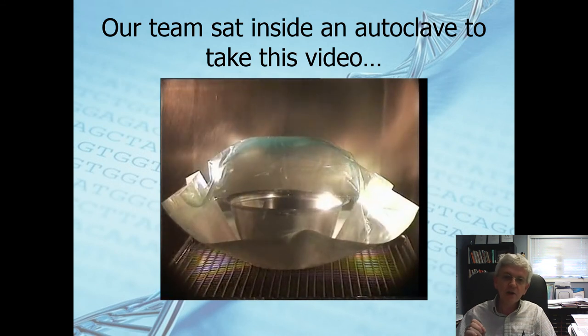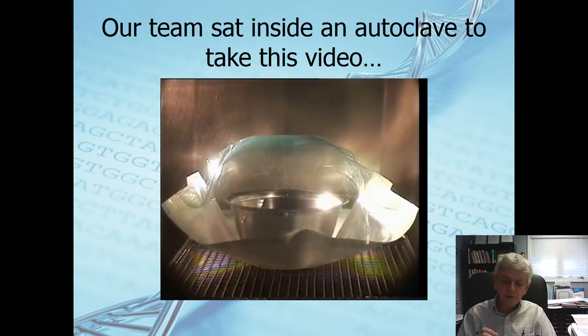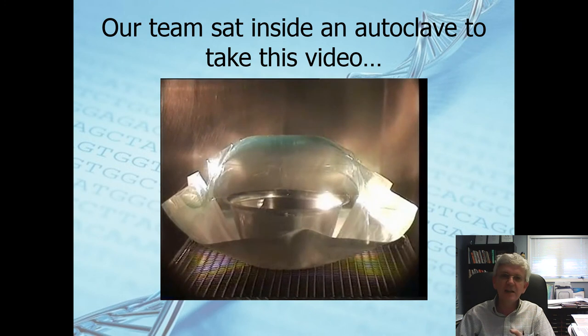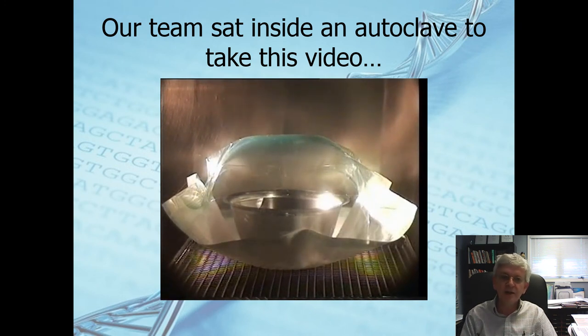That is a transference of energy from the steam to bacteria. It destroys it. This is why it's so effective in killing things. Look at this bag now. This is really blossomed up from what it was even before.